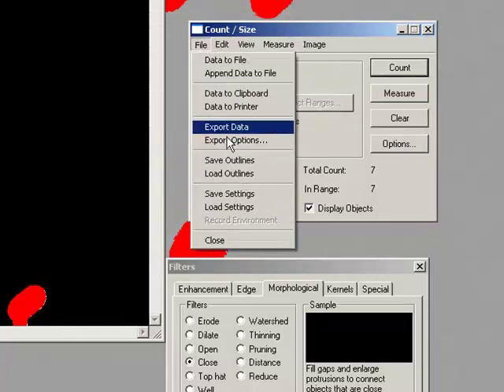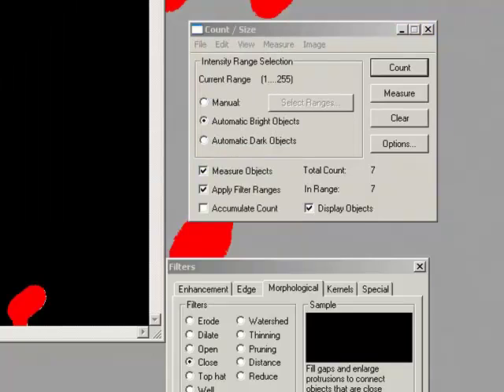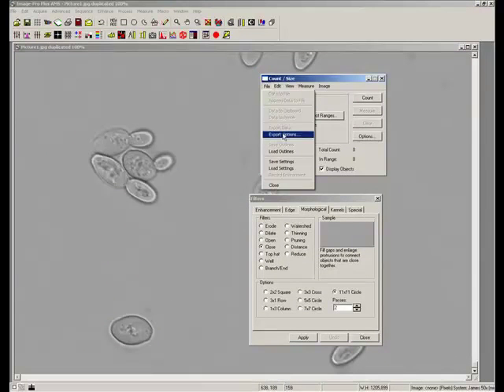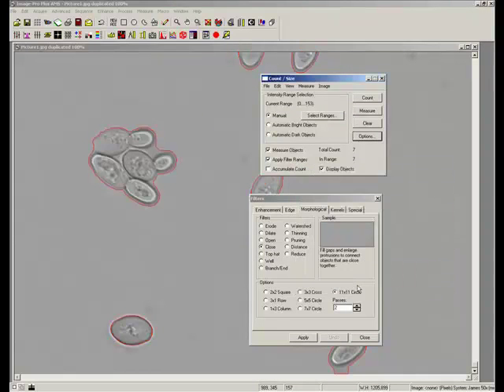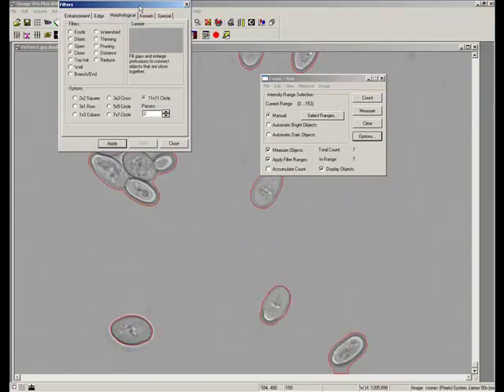In fact, what I'll do here is I'll just save these outlines into a file. I'll just overwrite that one. And we'll go back to this original file. Here we are. Sorry, let me just do that. And I'll load on these outlines. Just so you can see, if I put it to outline, you'll see how well I was able to actually pick out these objects. Okay.